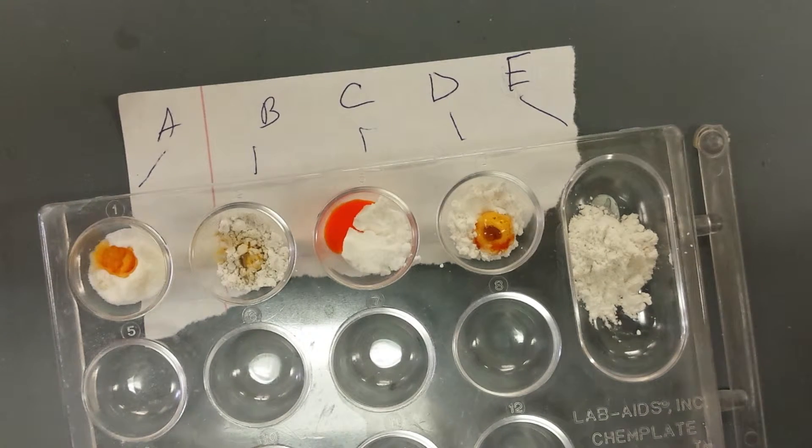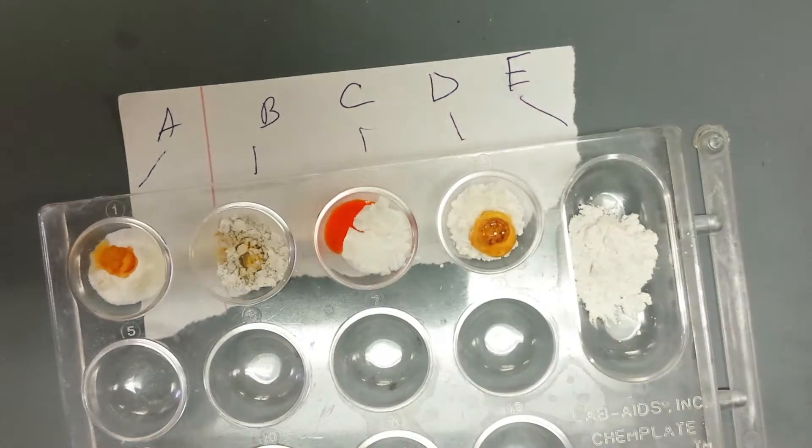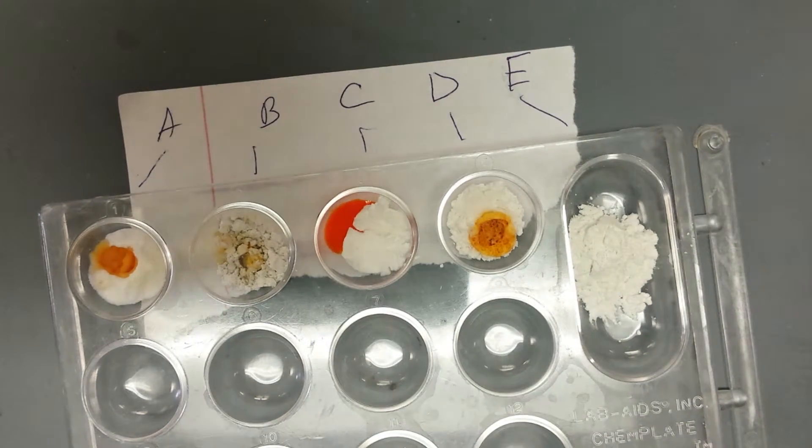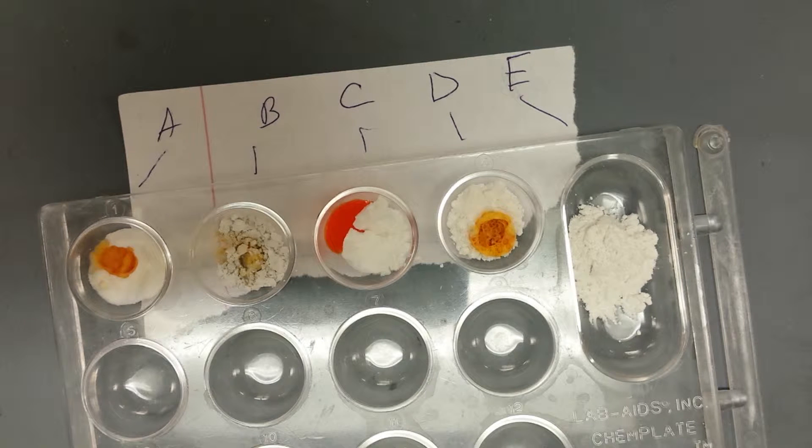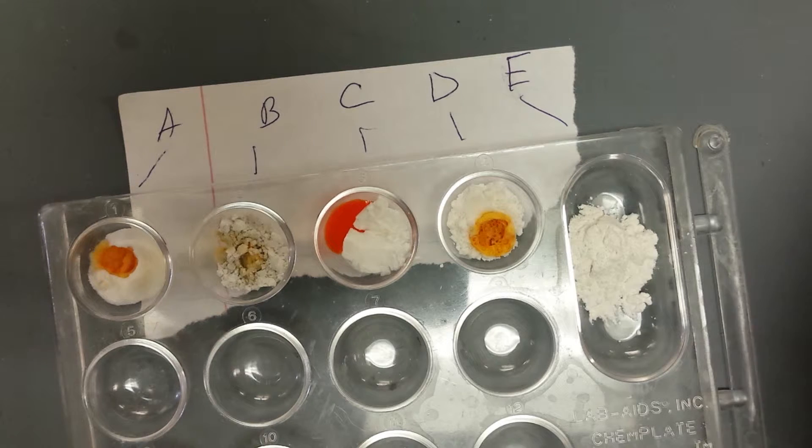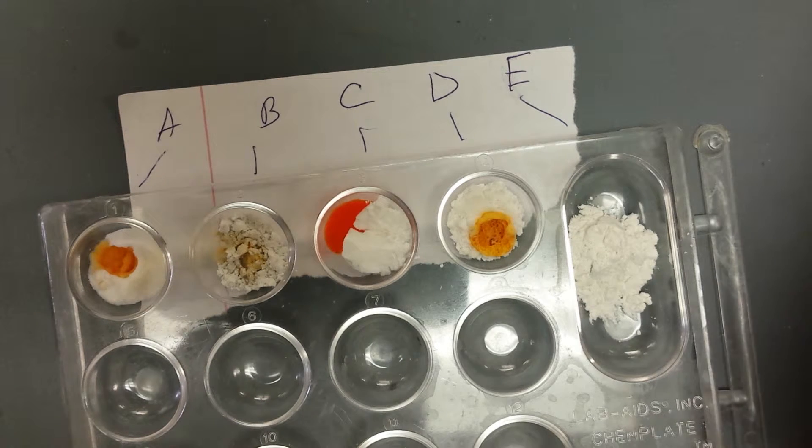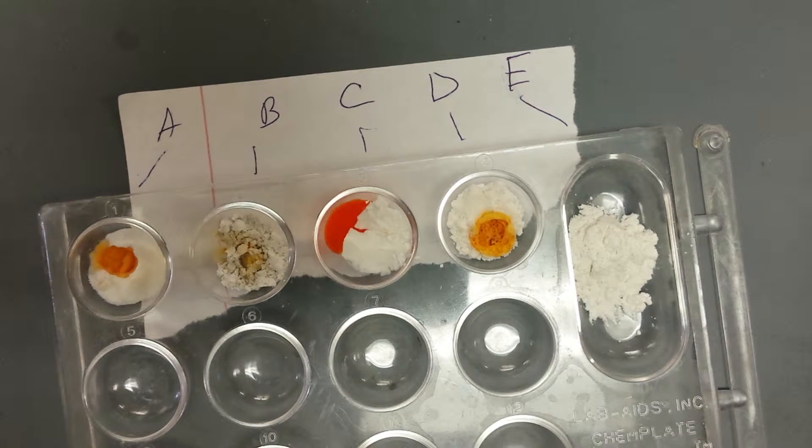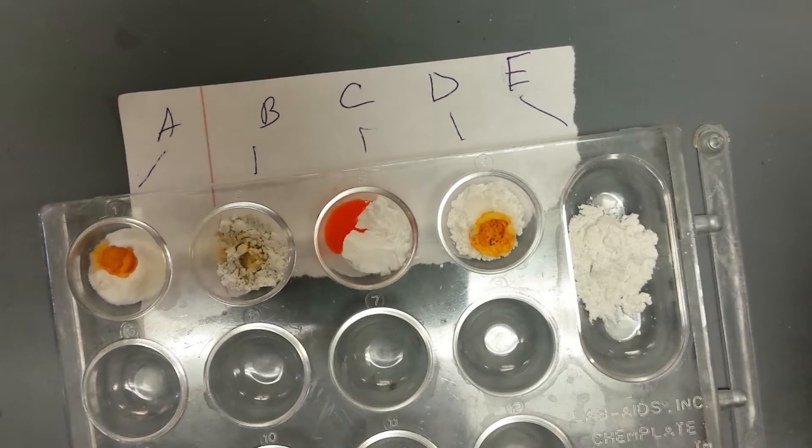Watch it. It fizzes. And then, and it turns hard. So it fizzes and it makes... look at it, it's making a big bubble. Oh, it popped. And it fizzes and it makes... that's how that one did too, it made a bubble. Fizzes, makes big bubble, light orange. Fizzes, makes big bubble. And what? And, it's like a honeycomb with texture. It looks like honeycomb, doesn't it? Can I do the last one? Honeycomb and what? I put in turns light orange. Turns, what'd you call it? Light orange. Okay.